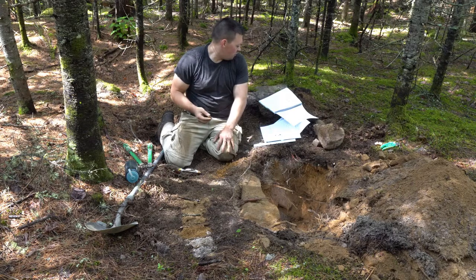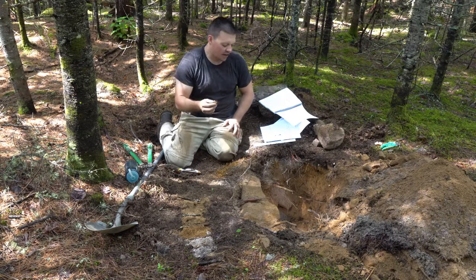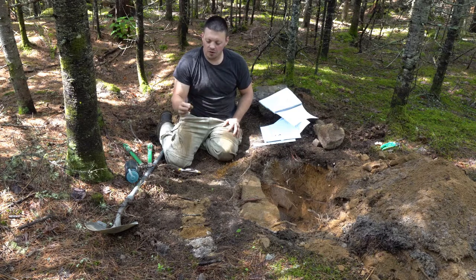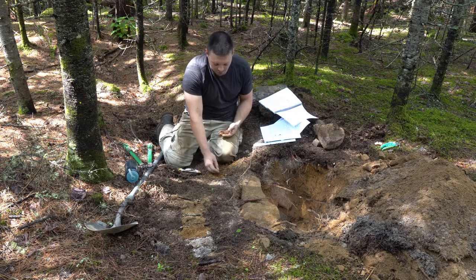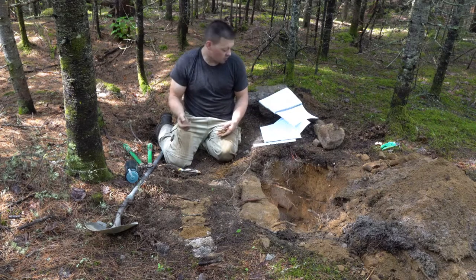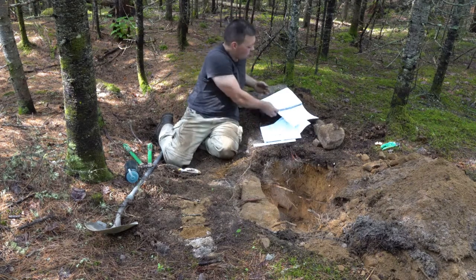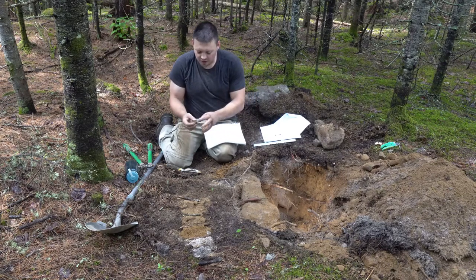And with structure, we look at the distinctness. So that's pretty much how does it hold together, what's the shape of it, what's the size of it. So if it holds together when we pull it out, you can see here most of it fell apart, so it's actually quite weak. So we say it's a weak structure. Now next we hold it up to our lab manual and we look at the edges of it. Is it rounded?